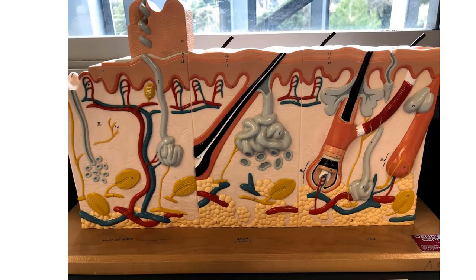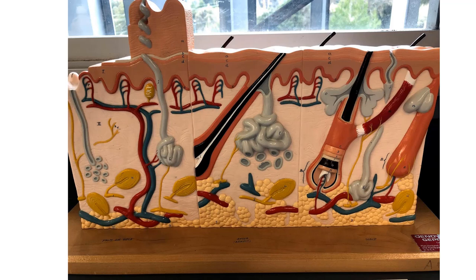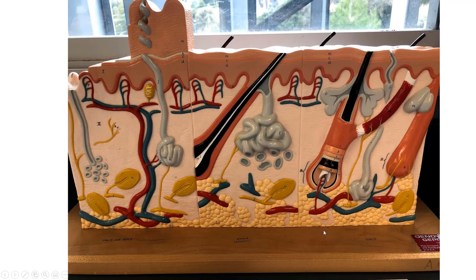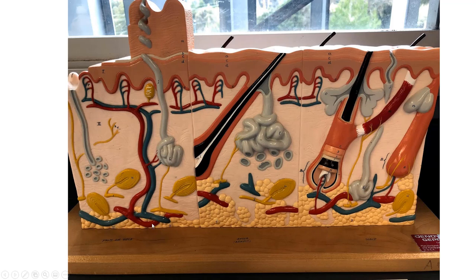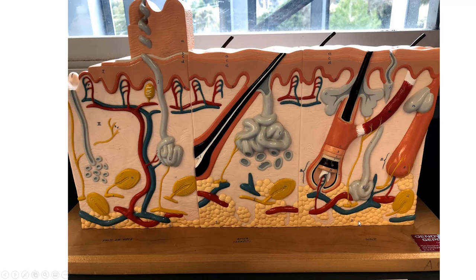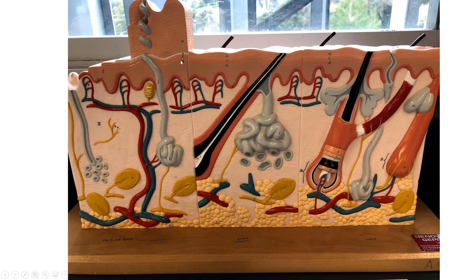This set of slides is going to be about the integumentary system lab. We're going to go through a few models and a few microscope slides. This is a model of the skin, and I'm going to point out a few things here. We have the epidermis, dermis, and hypodermis, and focusing on the epidermis we have different layers.